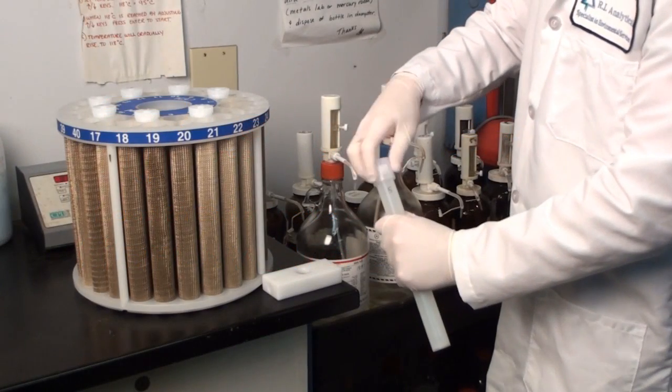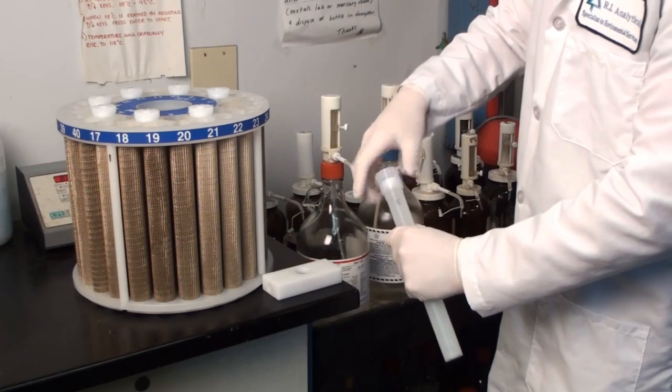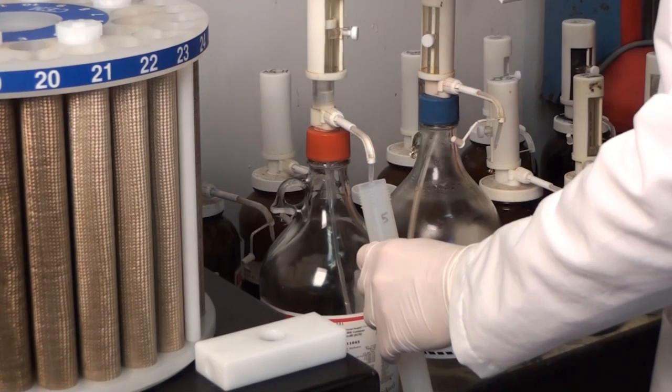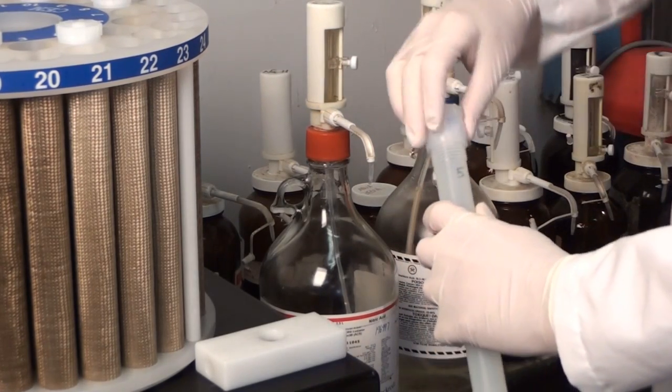Here is one of our technicians preparing your sample for microwave digestion. The process begins by adding one of several acids to the digestion vessel.